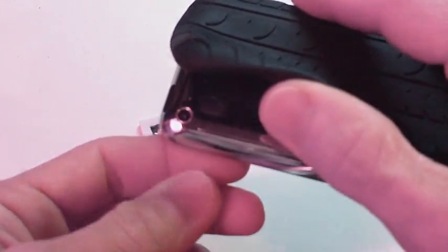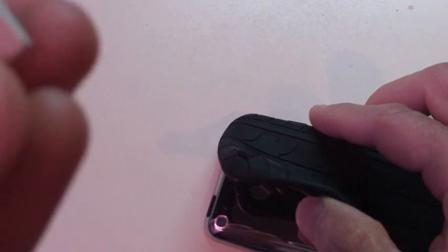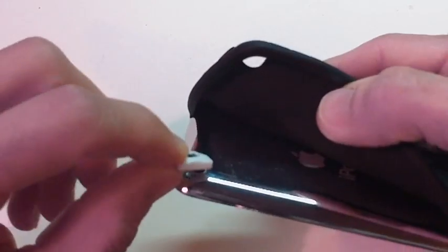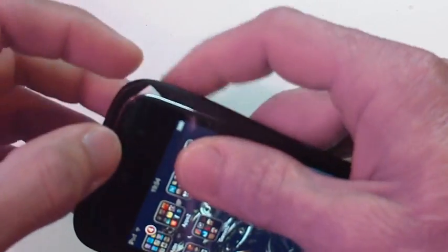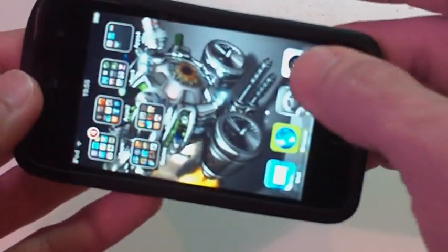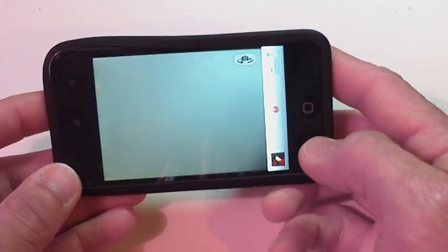Okay, let's close it for a second and locate the camera in the back. There we go. That's what it is. Take the magic lens and put it on, between the case cover and your iPod Touch. There we go. Let's open the application back up. That's still me. Turn the camera upside down.